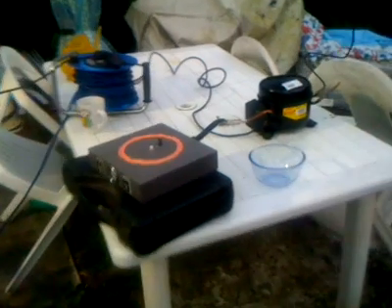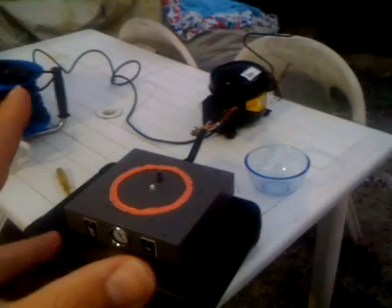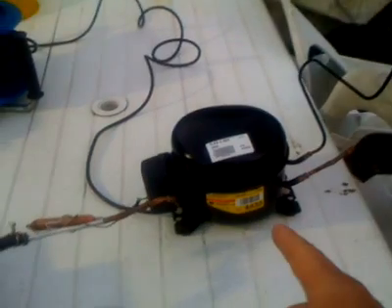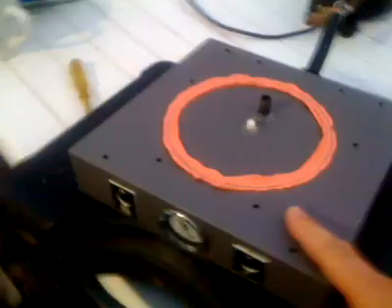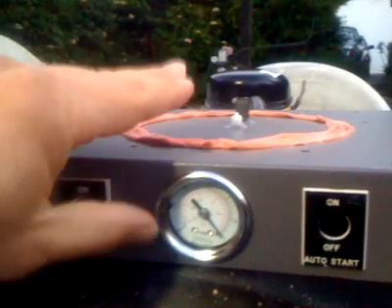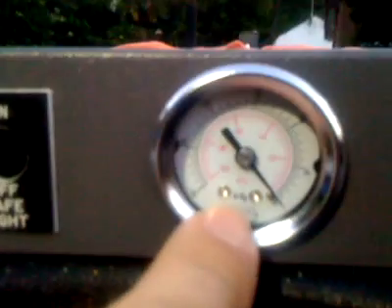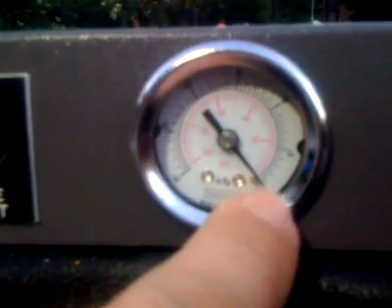This is my sort of testbed system for experiments with a vacuum pump, and the whole purpose is ultimately for freeze drying experiments. The testbed comprises a salvaged fridge compressor piped through to a salvaged device box that I think came from an old reprographics camera, where you use a vacuum to squish down artwork on a glass plate. But the most critical thing here is it gives me, albeit out of focus, a vacuum meter around the outside in the black, marked in inches mercury.